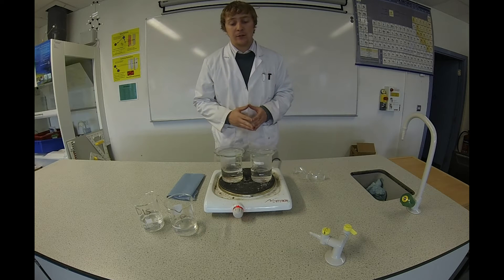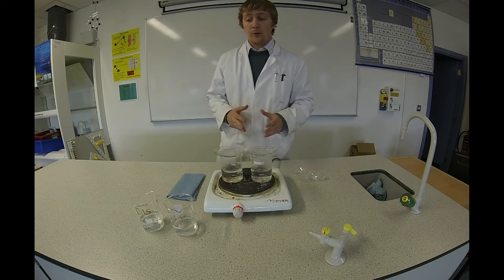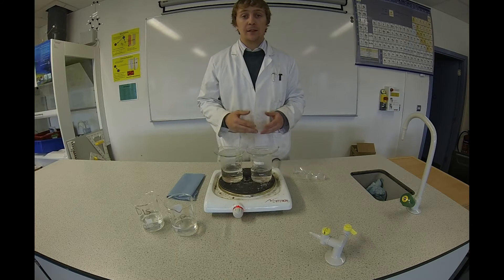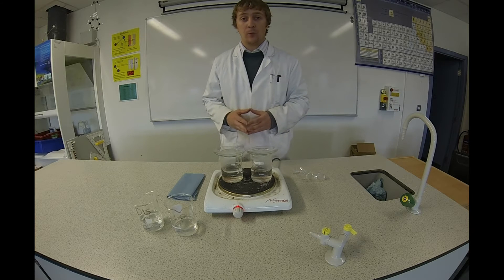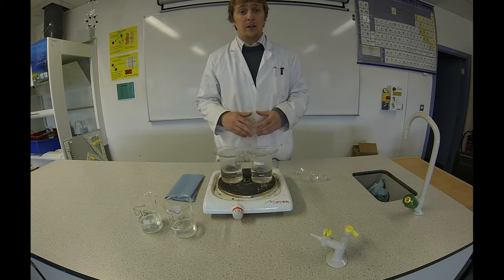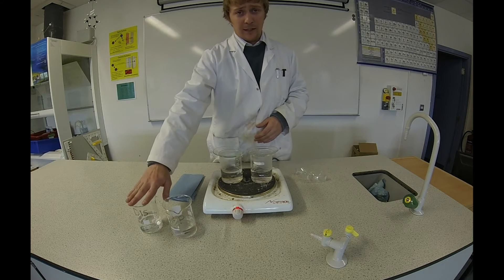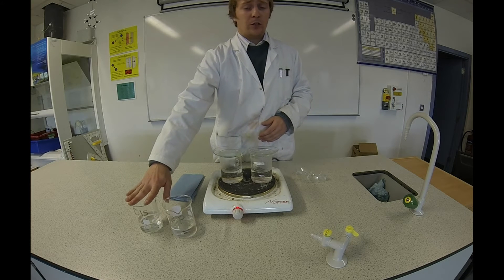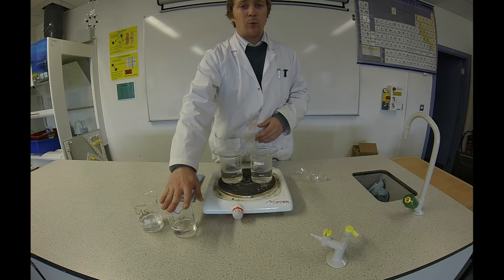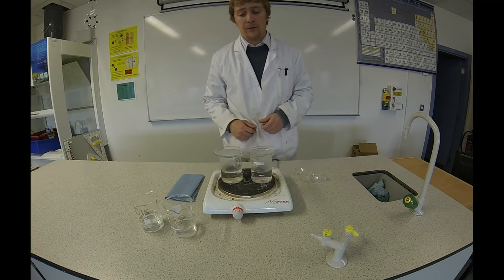Hi, welcome to Science4Schools. In this episode we're going to investigate the presence of dissolved substances in a sample of water. For this you're going to need two samples of water. I have some distilled water which should have no dissolved solids in it, and I have some tap water which might have quite a few dissolved solids in it.